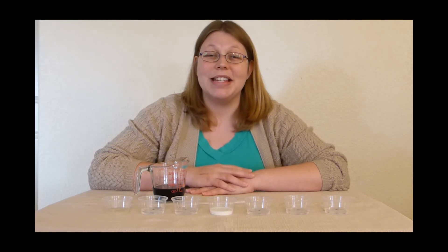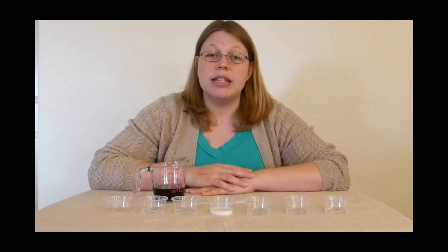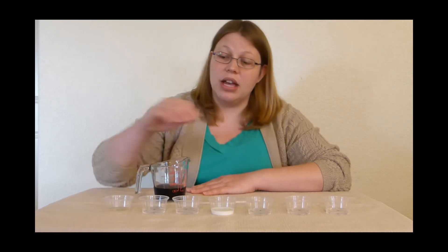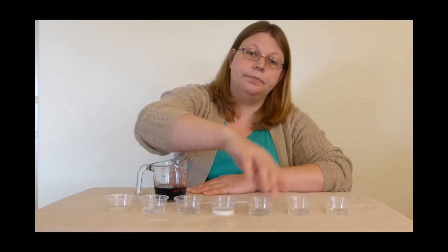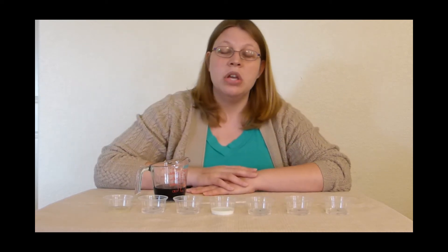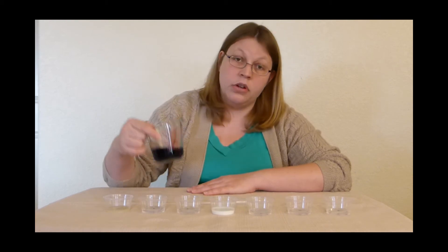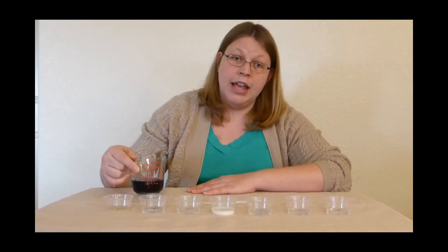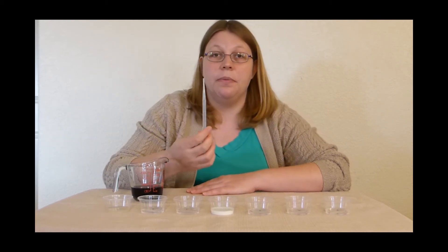The first thing we need to do is gather our materials. We will need a small sample of each of the unknown household liquids, our red cabbage indicator, and a pipette for transferring the indicator.